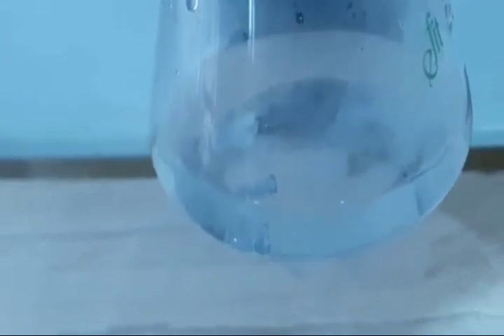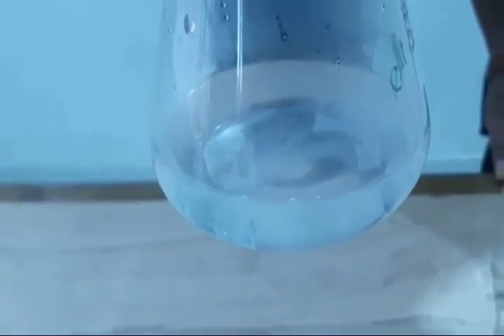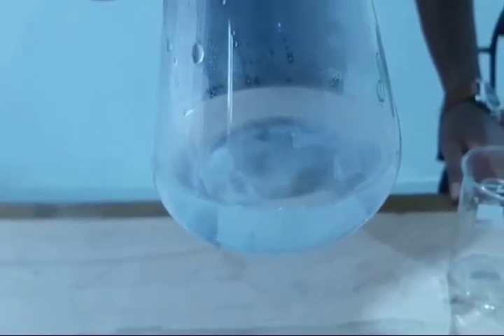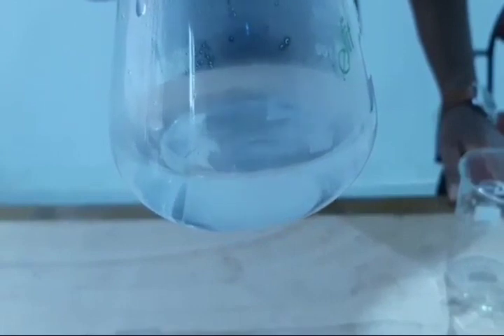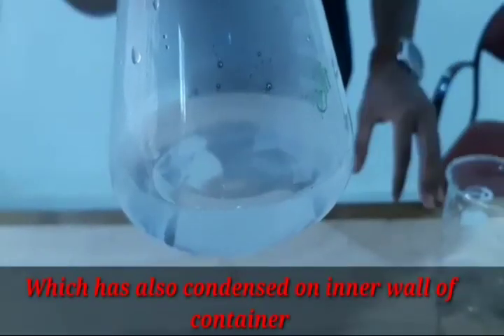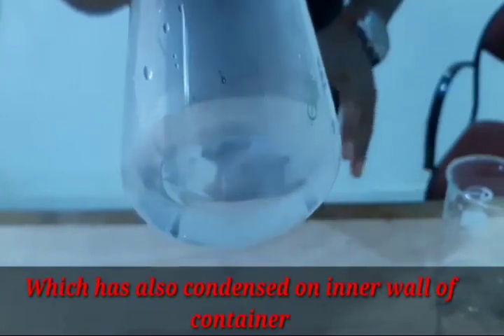The inside wall is condensed because the zinc metal reacts with the dilute sulfuric acid and produces hydrogen gas, which has condensed on the inner wall of the container.